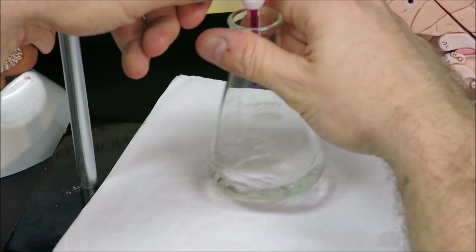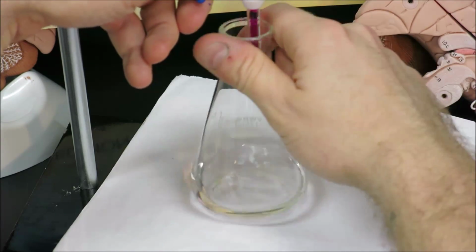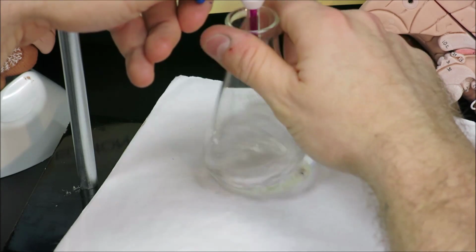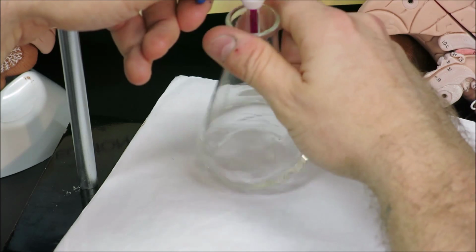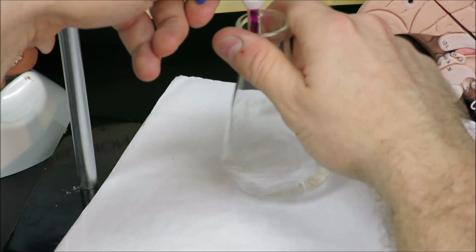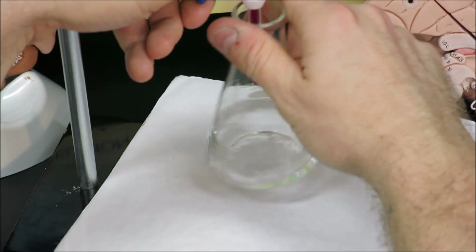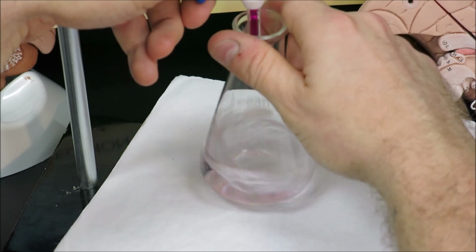But it is important to take time and not to rush a titration, because once you've overshot, that trial may not be included in average calculations. So even though this may seem slow, it does help to not have to do a 4th or 5th trial in order to deal with an overshoot.